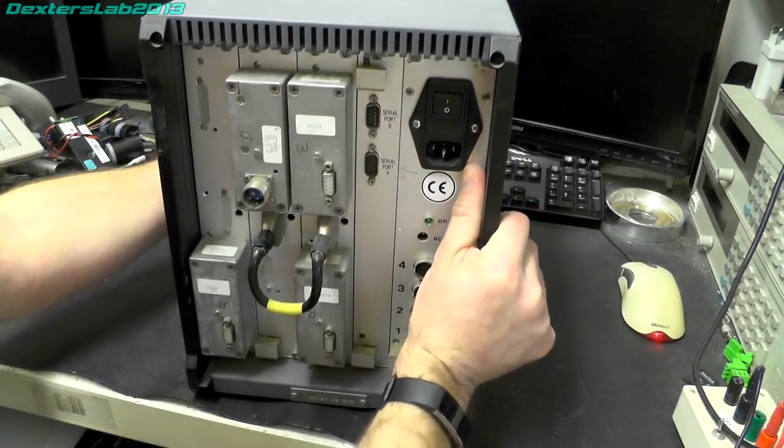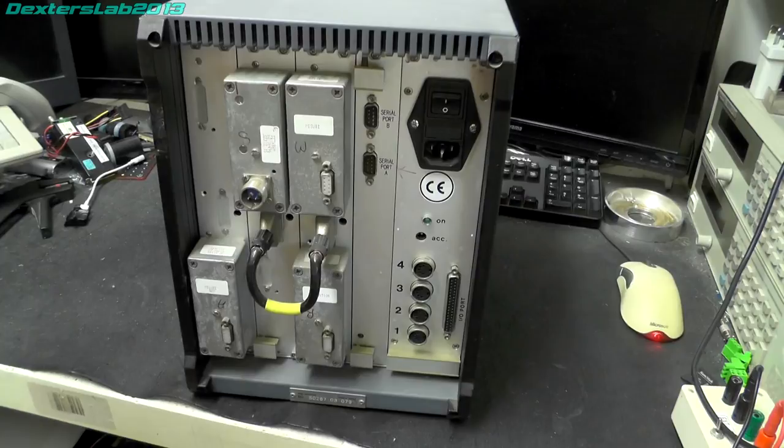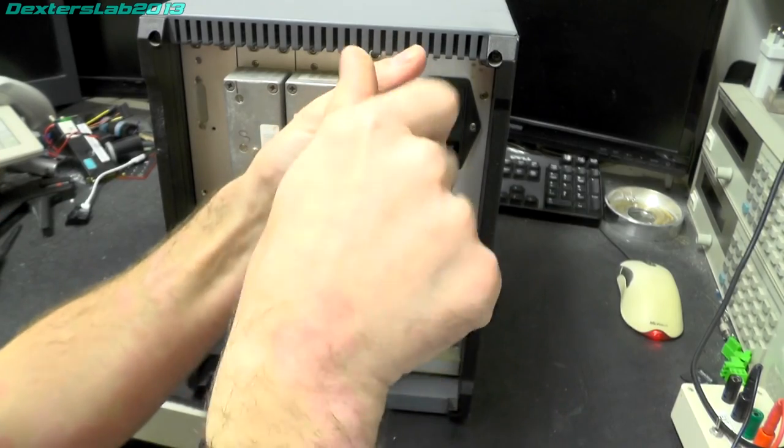That's never a good sign. So let's start taking these cards out, and we'll see what is what. So we'll start with what seems to be the power supply.